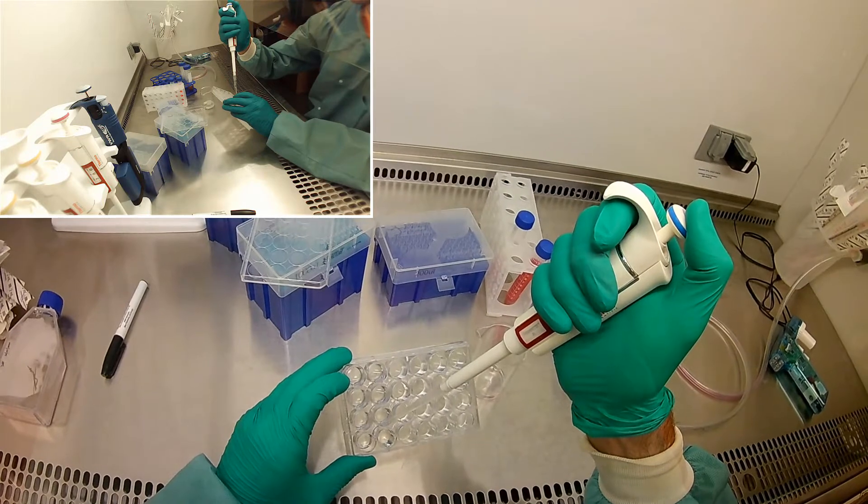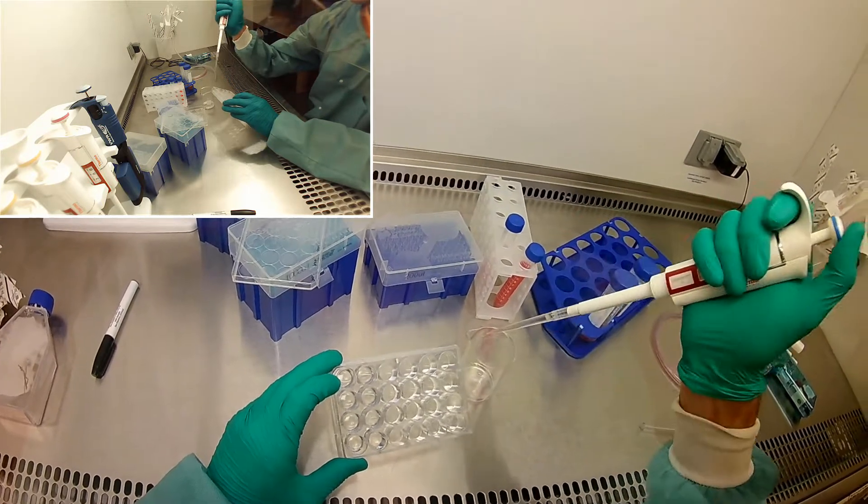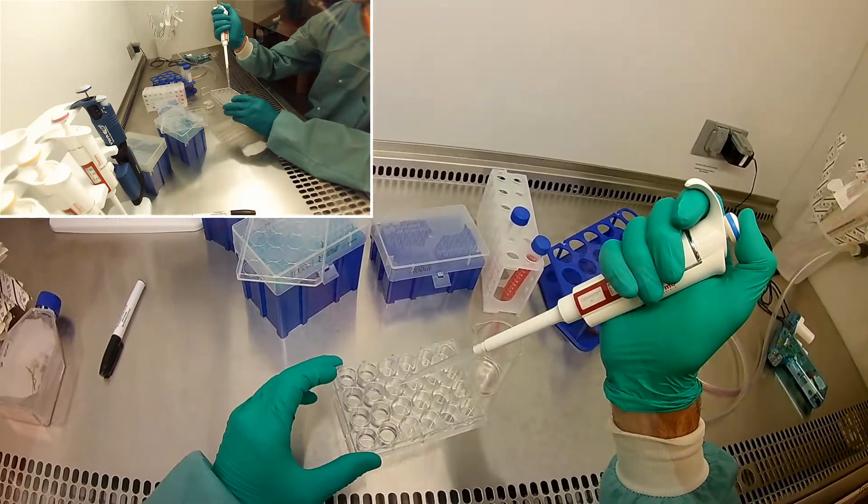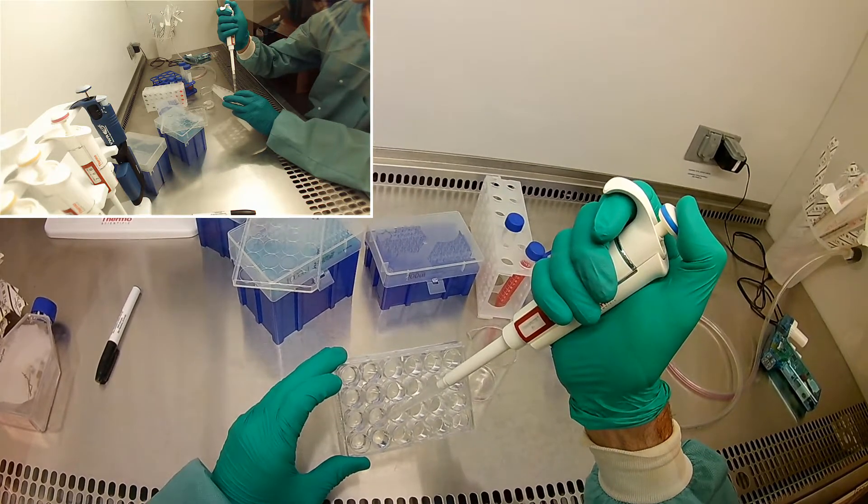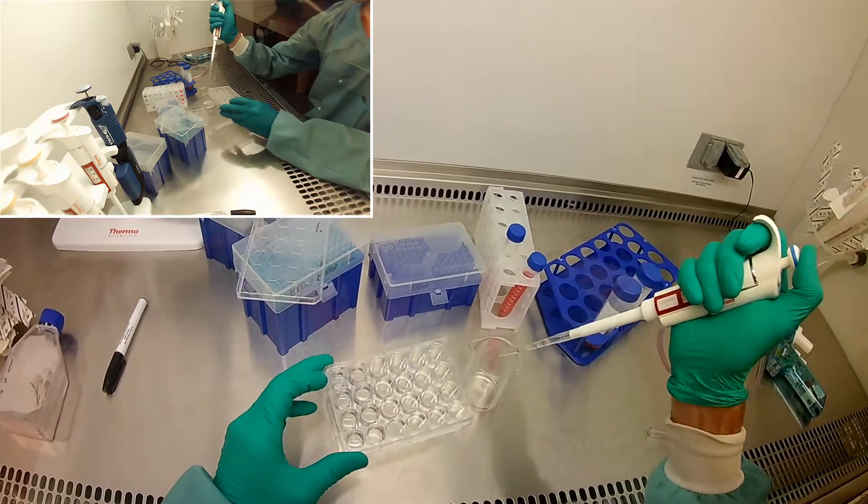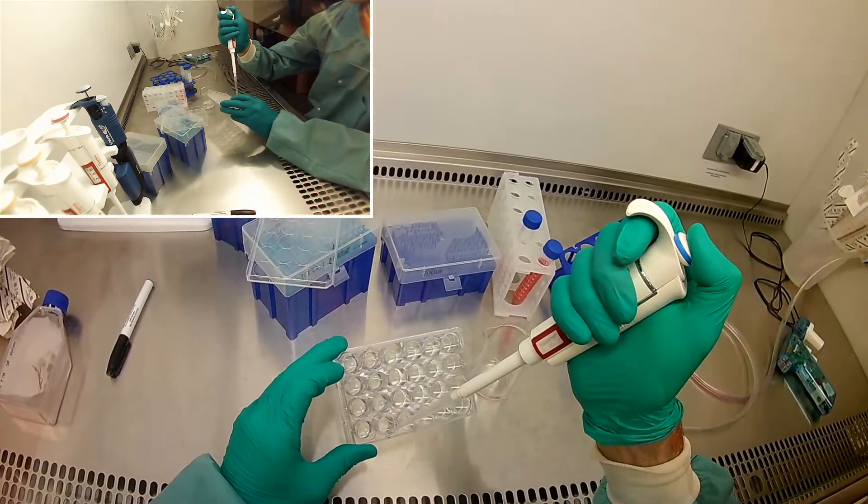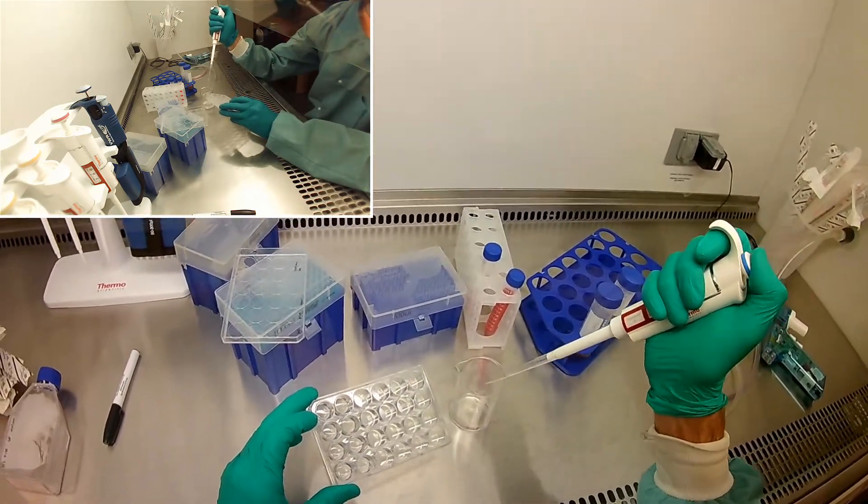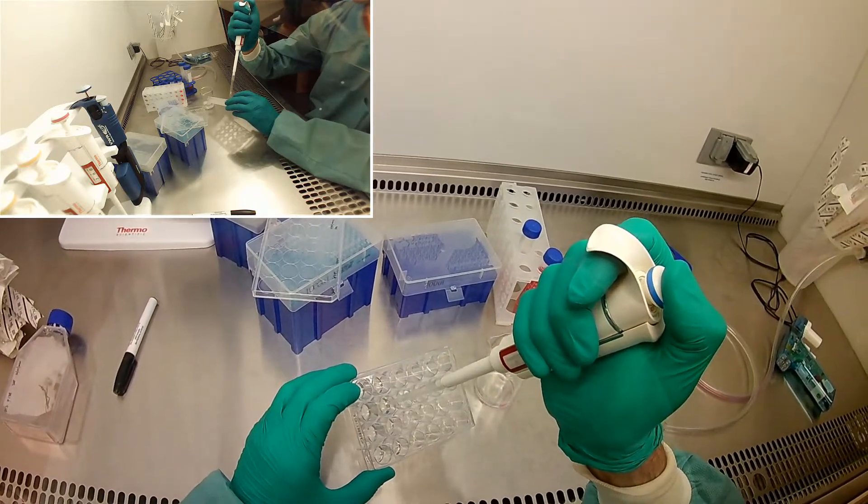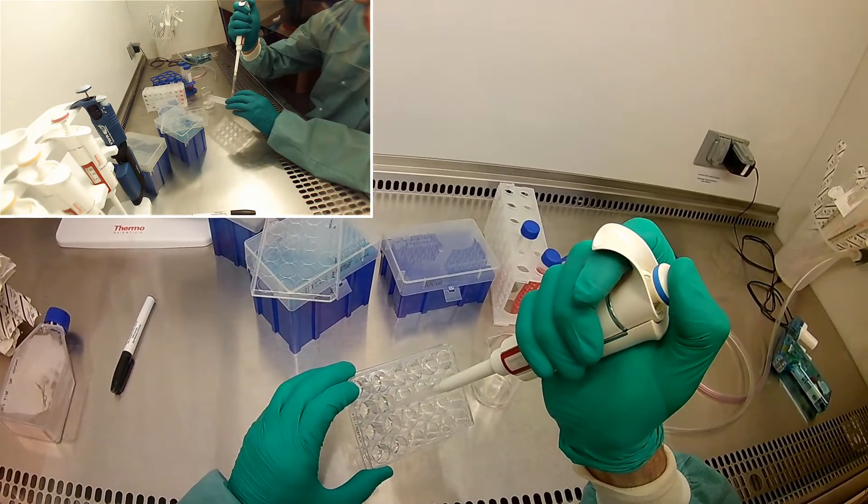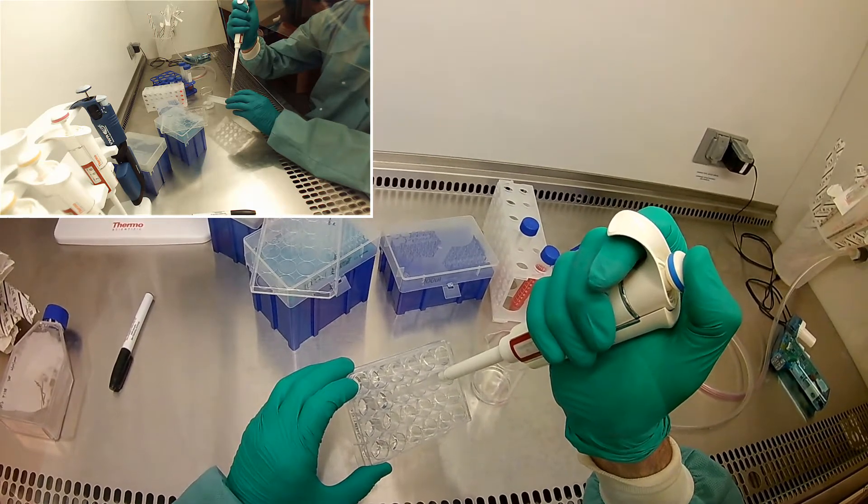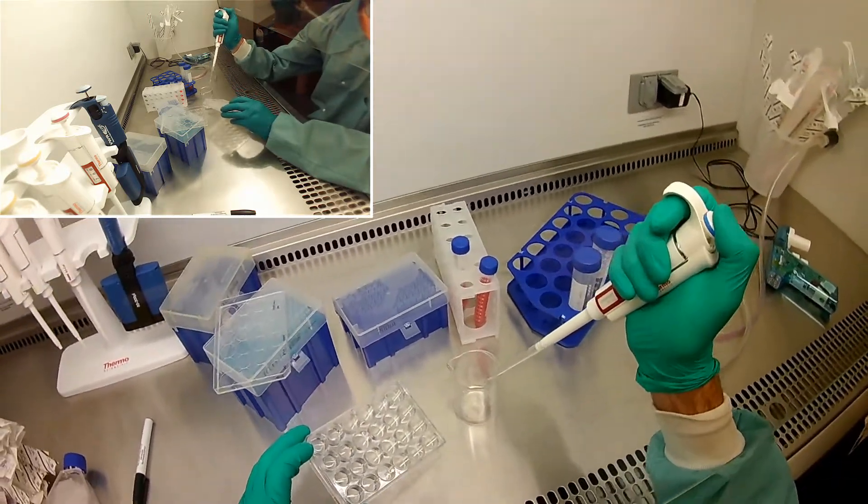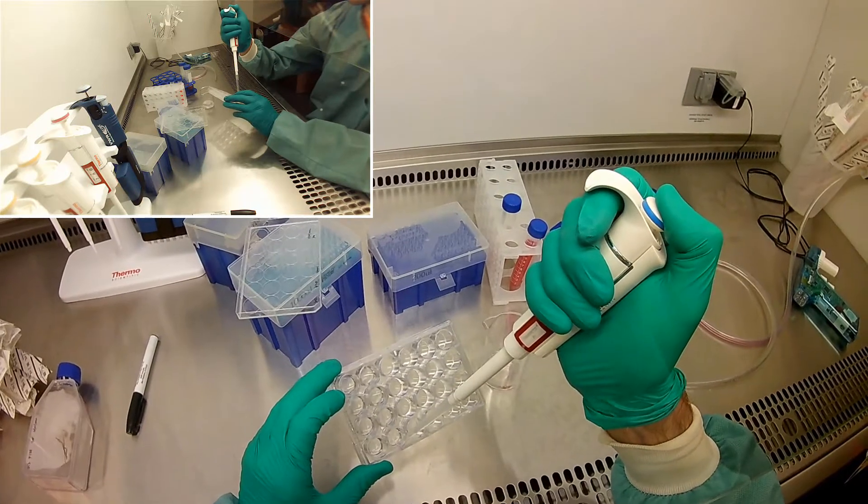It is difficult to see where the hydrogel begins and the liquid ends or vice versa. Some of these, the hydrogels may not be stuck to the bottom as well as I had hoped. I think the second one, the hydrogel is definitely floating a little more. But this third one, it's stuck to the bottom pretty well.